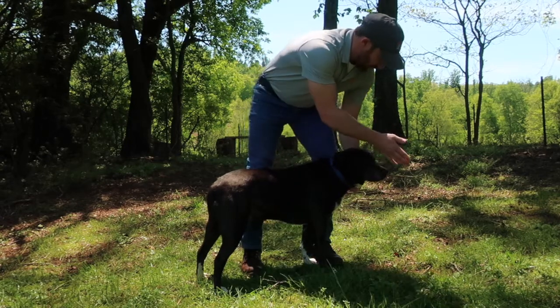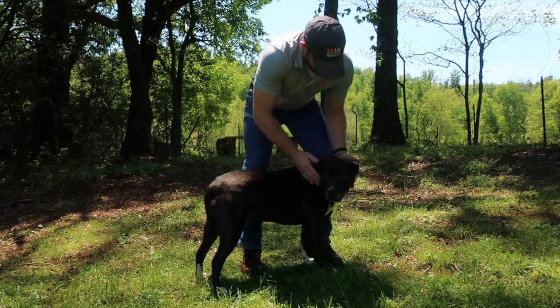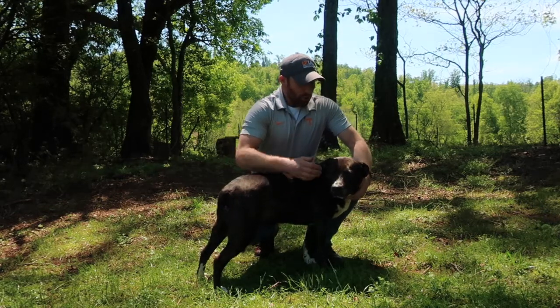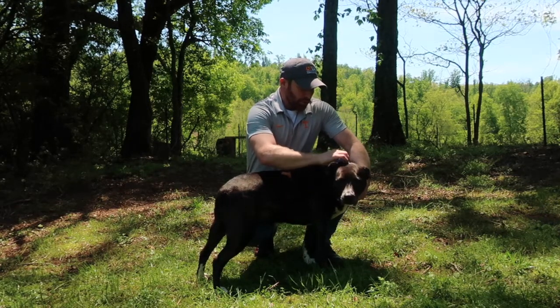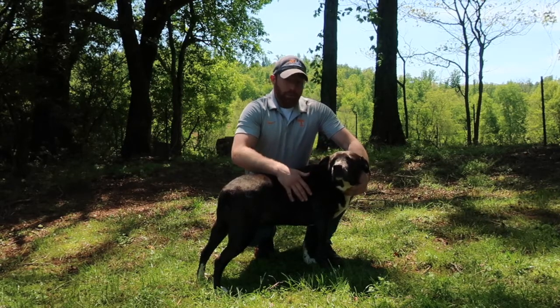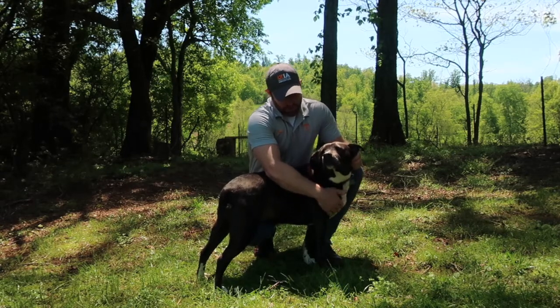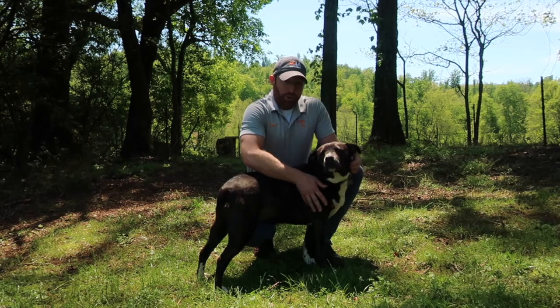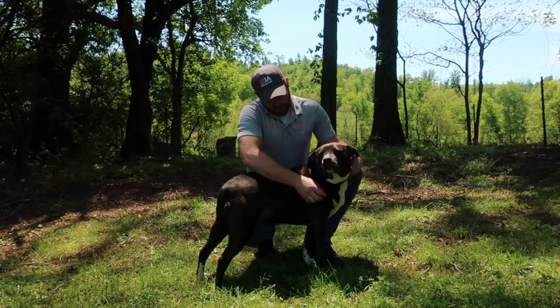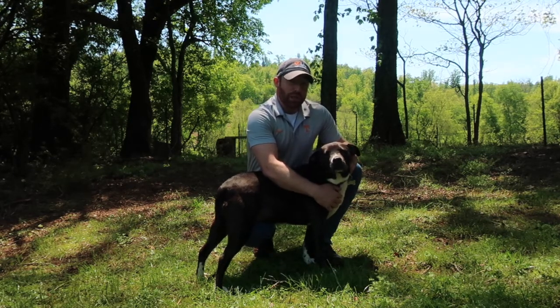One other line: if we drew a line this direction through Charlie, right through her nose, all the way down, we would separate Charlie into two equal halves. We would say structures that are more towards the median line, that line down the middle, are more medial. And things that are further away from that are more lateral. For instance, Charlie's heart is more medial than her thoracic limbs, her two front limbs. And her thoracic limbs are more lateral compared to her heart, which is more towards the center.